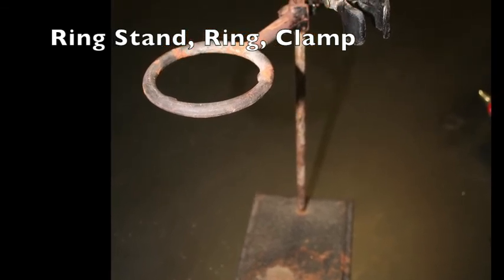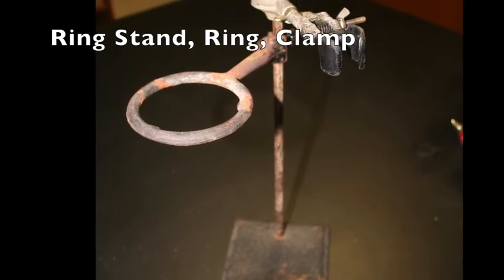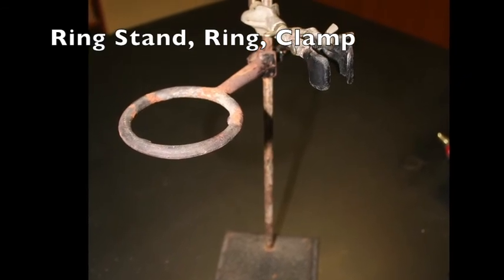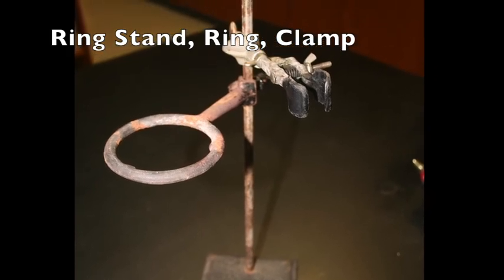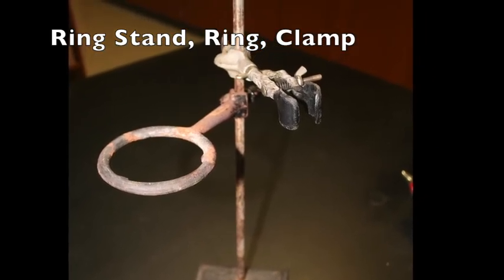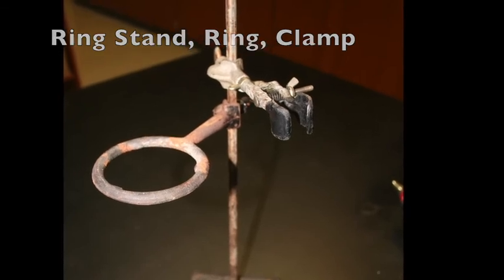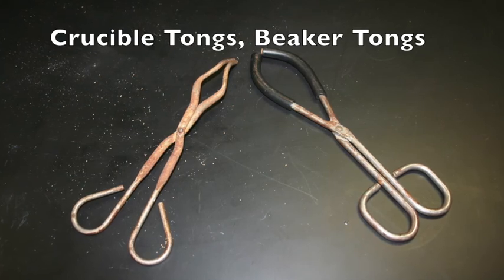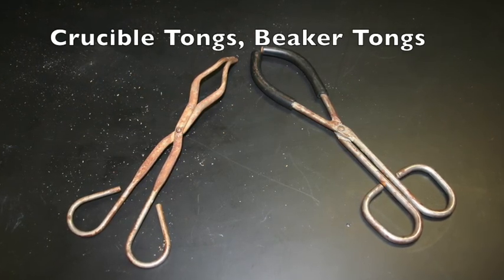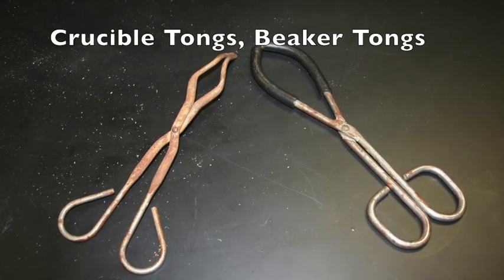A ring is secured to the metal pole and a wire gauze square can be placed on top of the ring so that a beaker of a substance may be heated by a Bunsen burner below. Also shown here is a clamp that is useful for supporting test tubes, thermometers, or other small diameter items. On the left in this picture is a pair of crucible tongs, while on the right is a pair of beaker tongs. The crucible tongs may be used to grasp and pick up objects.